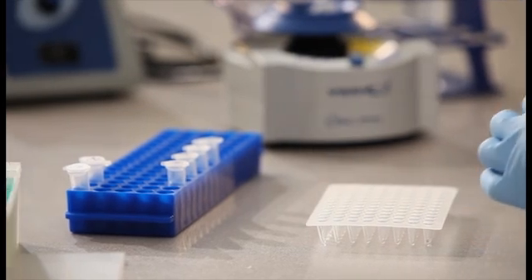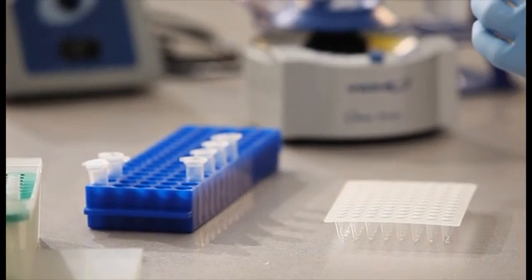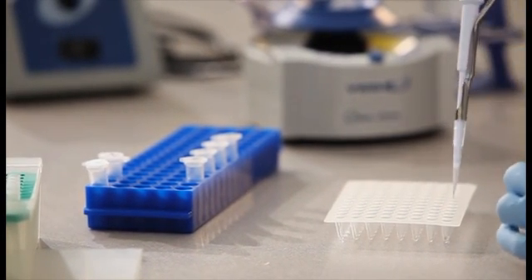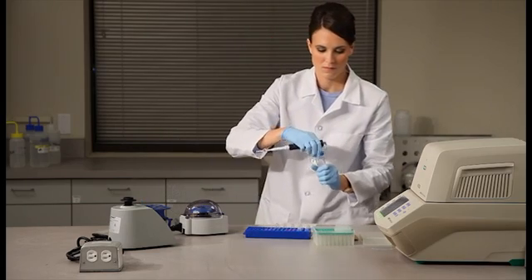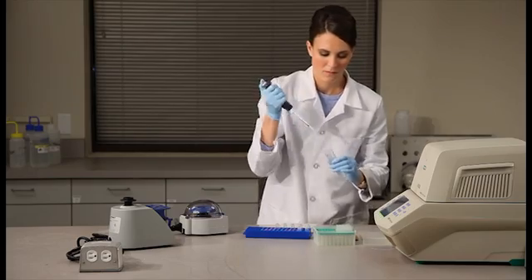Remember to change pipette tips between each well. Each sample will be run in duplicate for both assays. Use nuclease-free water as a no-template qPCR control.